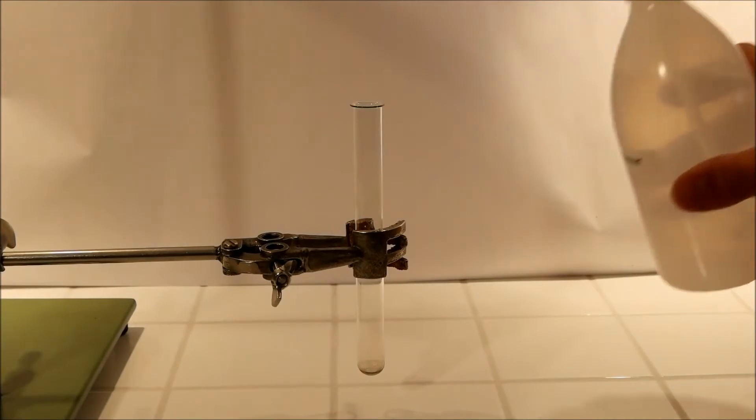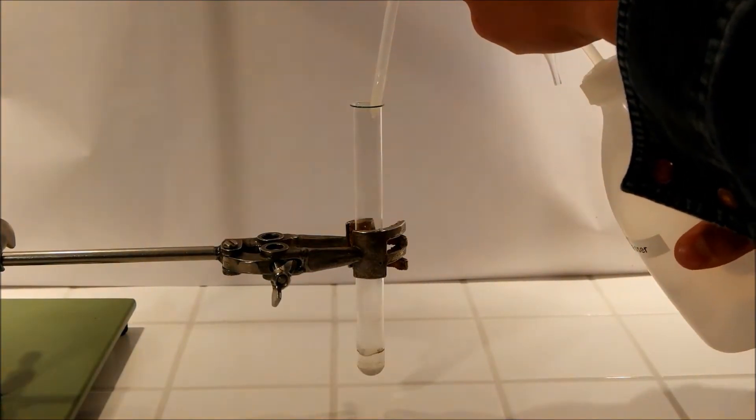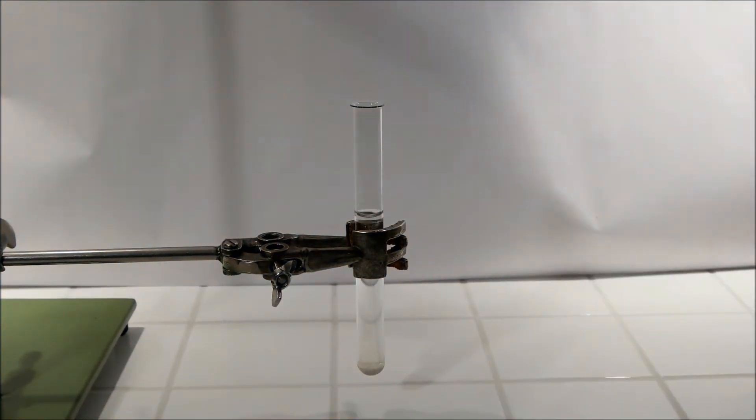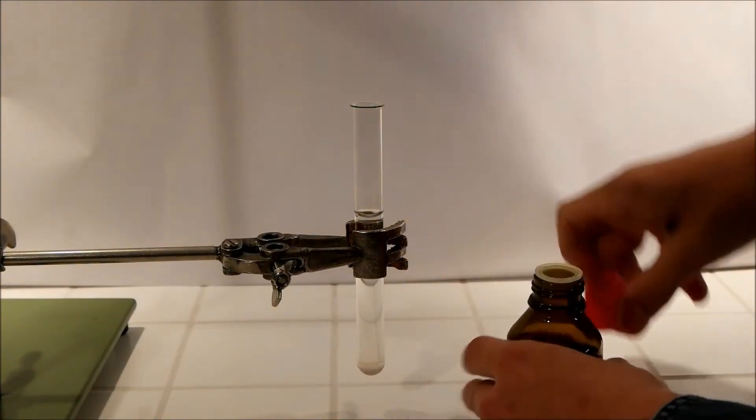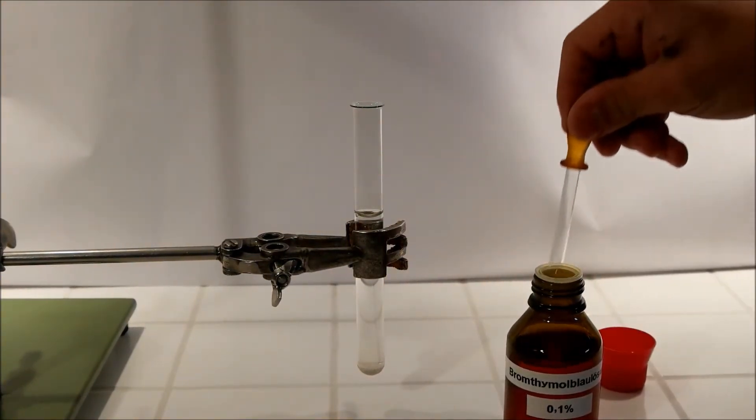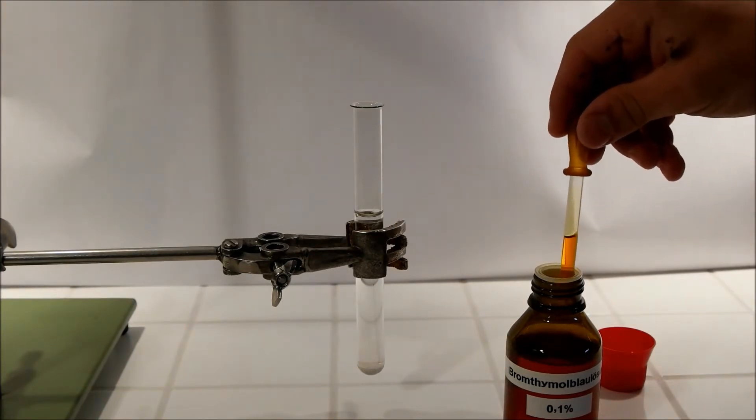So I'm going to put a bit of water in a test tube and then add a few drops of Bromothymol Blue which is an indicator.